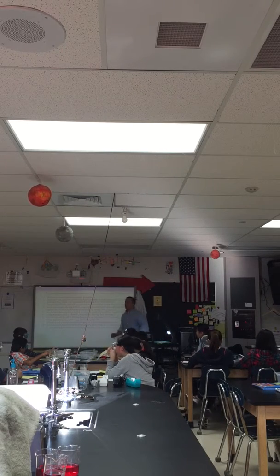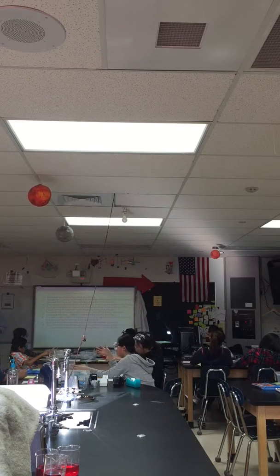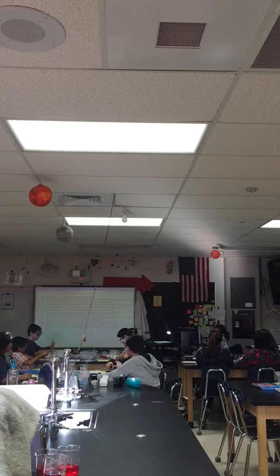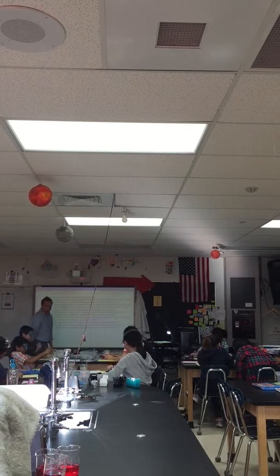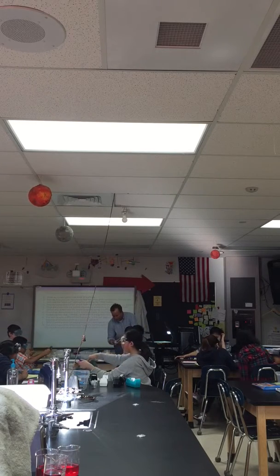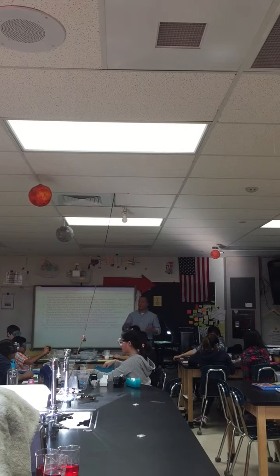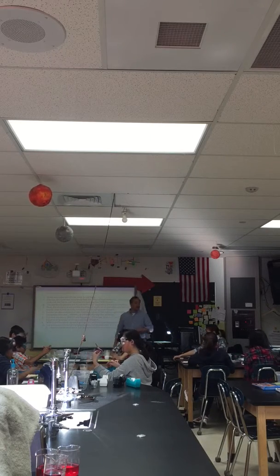First thing you need to do, it should take no more than 10 seconds, is to make sure that your scale is working. Just hit the power button, be patient and wait. Make sure it turns on to 0 and you have a little G in the corner for grams. You'll be fine. If it is not working, we're very limited on the scales. You might have to use your partners as well. So make sure there's a G and zeros. Are you with me?